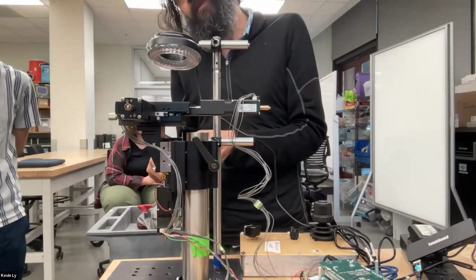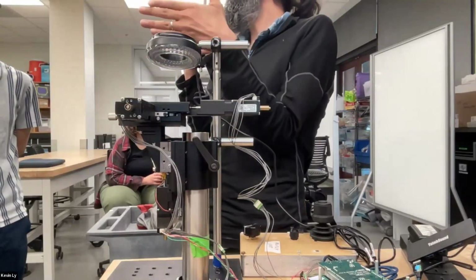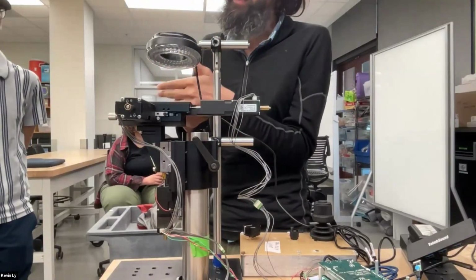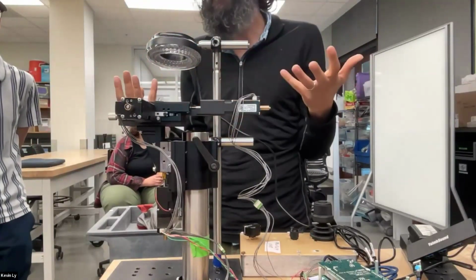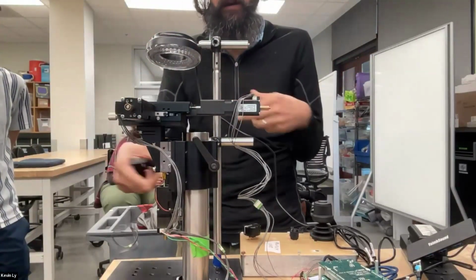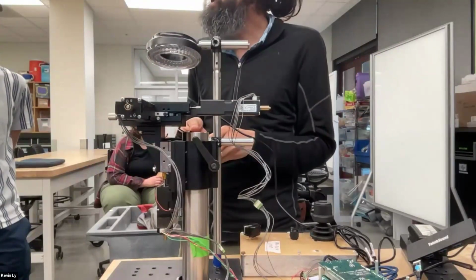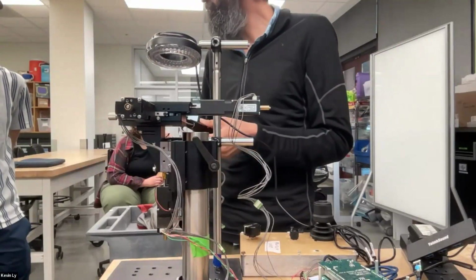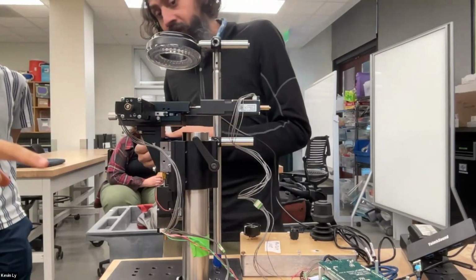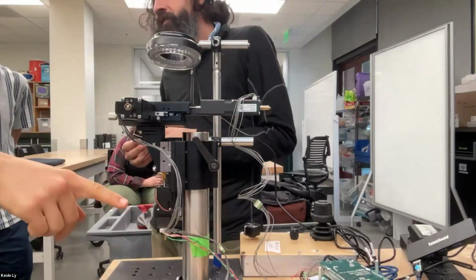So that's a piezo. Because the Z-axis is very sensitive to focus, and you need to move in nanometer steps. And piezos allow that, a super cheap component. If you need nanometer scale precision, tens of nanometers, that can be done there. There are drivers that are associated with piezo because they're high voltage drivers, but there are commercially available drivers. So there's the little linear motor driven actuator there.